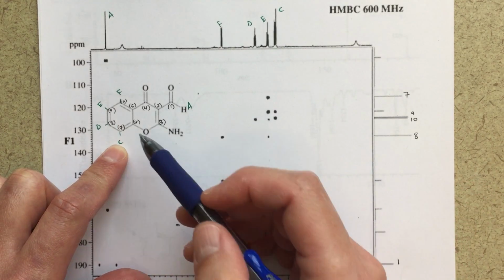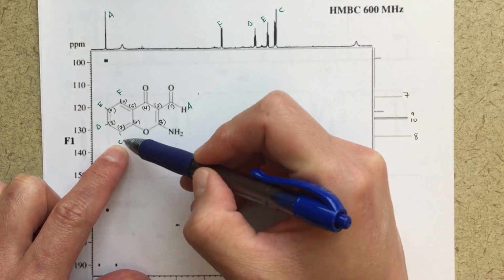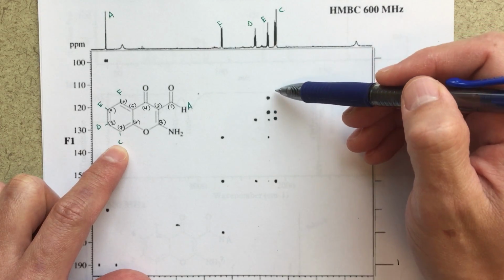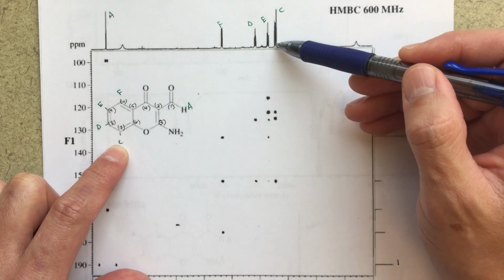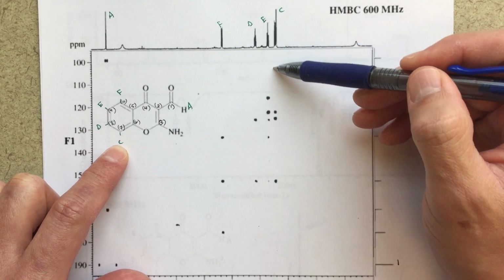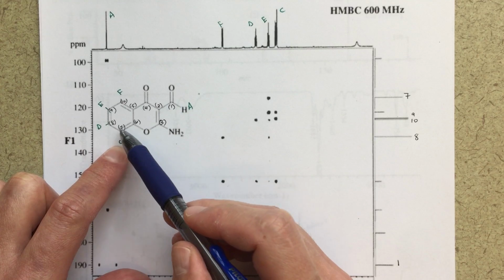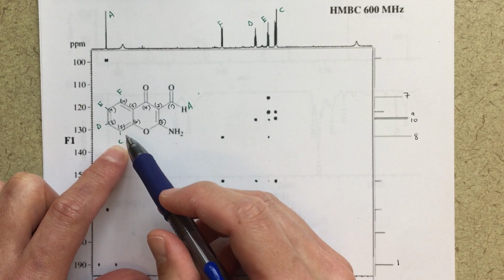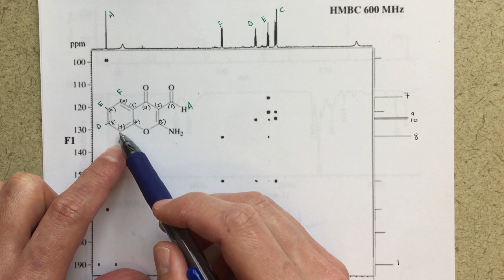So, when we're talking about bond correlations, for this C proton, this would be 1 bond to get to 7, and I'm not going to see a correlation with 7. So there shouldn't be 1 bond correlations. We might see one as an artifact a little bit later on, but in general, if this is my line for C, then I should not see any correlation with 7. I might see a weak correlation with 8, a weak correlation with 6, or I might not see anything at all. But I should definitely see a strong, 3-bond correlation with 9, and I should see a strong correlation with 5.